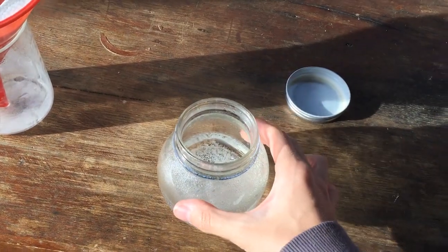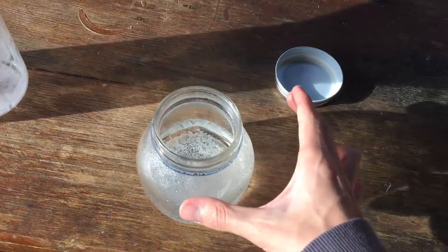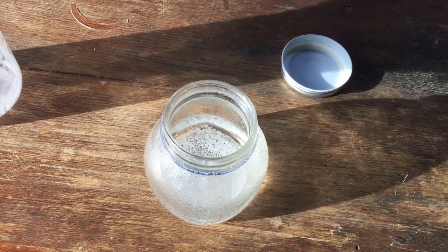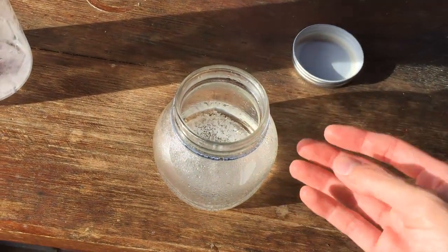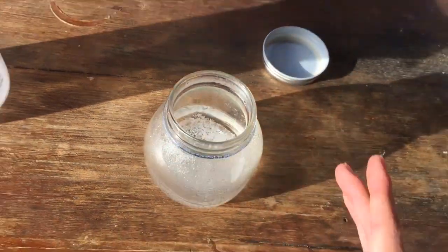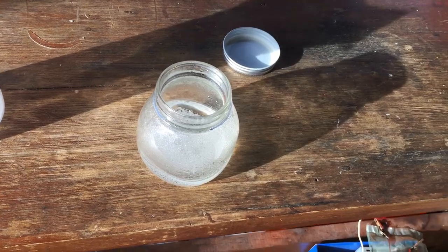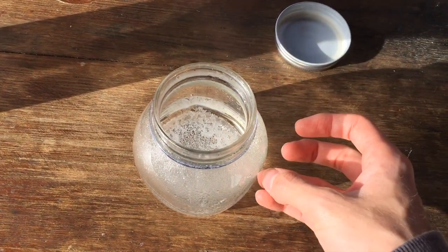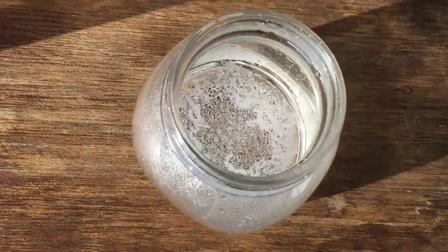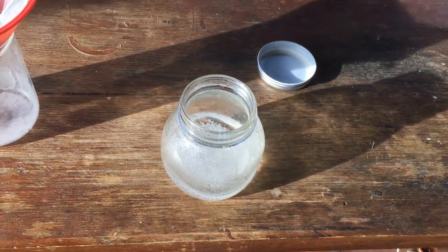Using this method we can crystallize out pretty much just the potassium chloride. It's a really good way of separating sodium chloride from potassium chloride, because the solubility of potassium chloride in water at 100 degrees is quite a bit more than it is at room temperature. So quite a bit of potassium chloride is going to crystallize out as it cools. But for sodium chloride, the solubility doesn't really change much from boiling to room temperature, so we'll get a negligible amount crystallizing out. We'll filter this off and it should be pretty much pure potassium chloride.